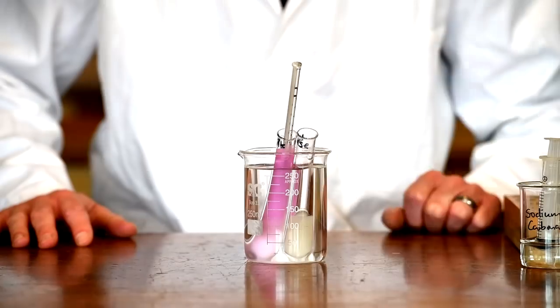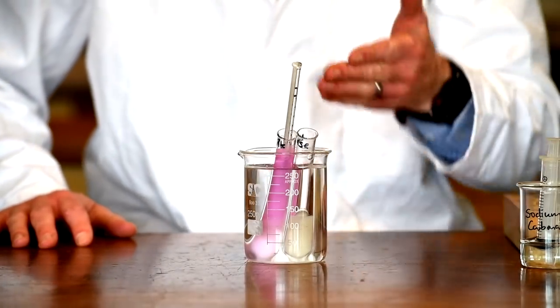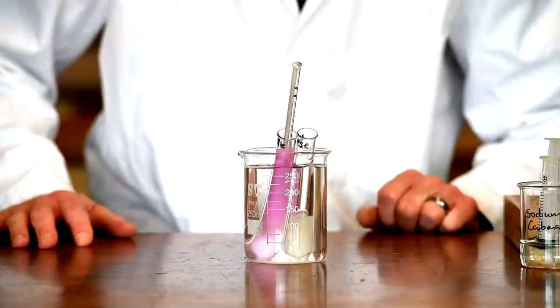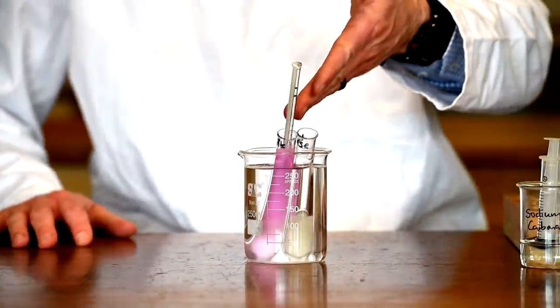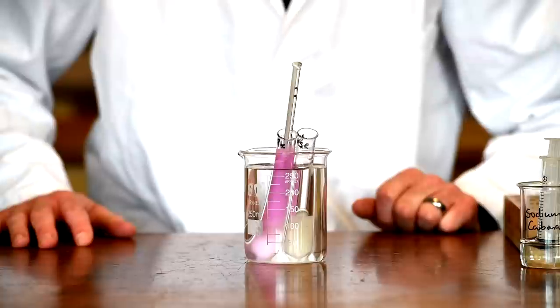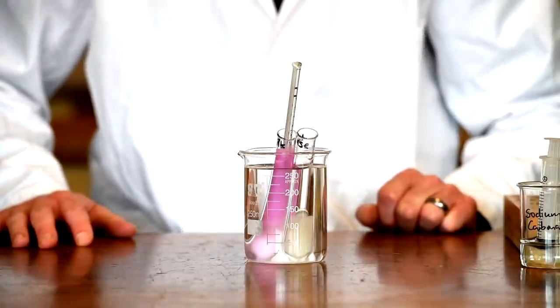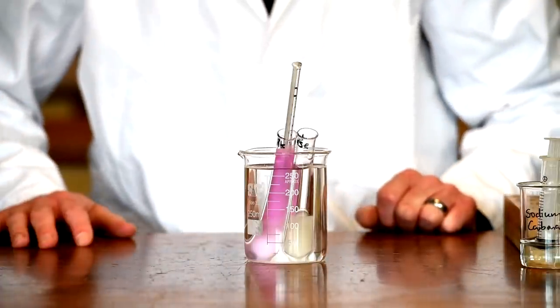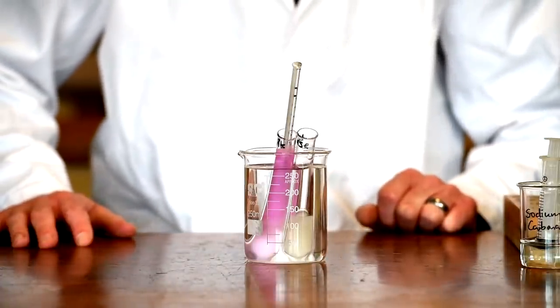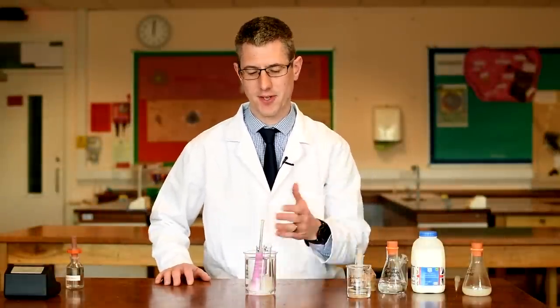Now I have some milk and our lipase enzyme. I'm going to place them into a water bath that I've measured to be at 60 degrees Celsius. I want to be certain that the liquids inside the test tube are at the correct temperature. I've placed my thermometer into the milk test tube so I can measure the temperature of the contents of that tube, and I need to wait for the contents to equilibrate to 60 degrees Celsius, which is my first experiment.